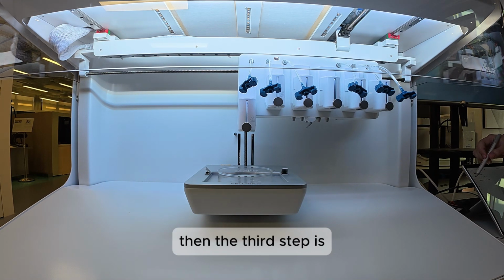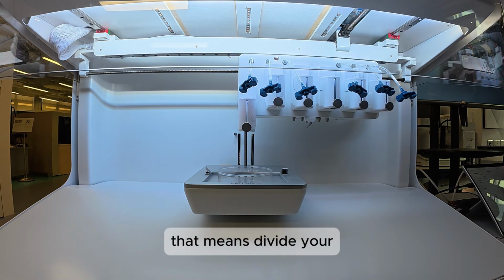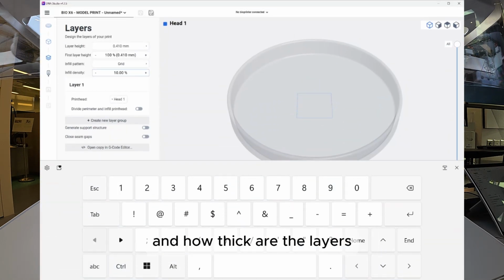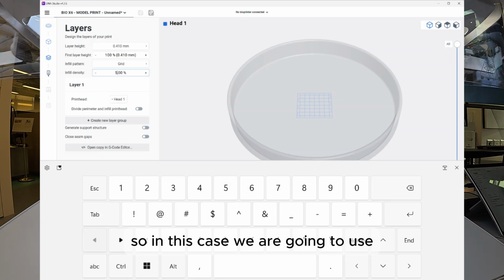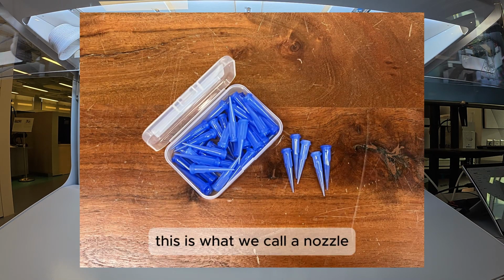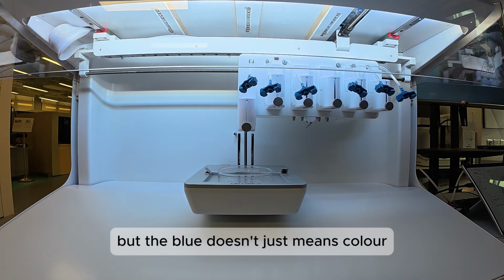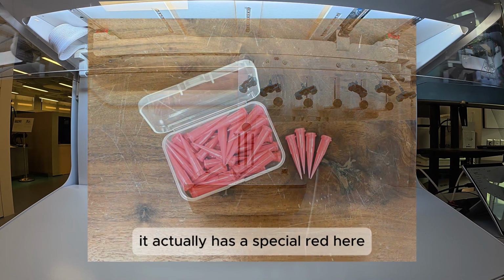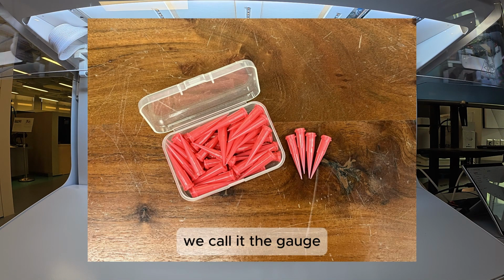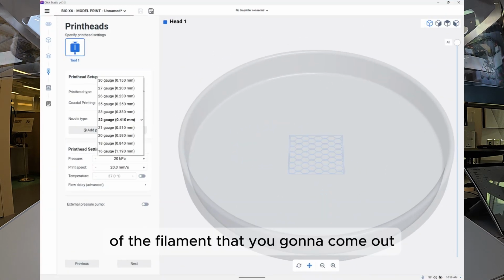The third step is that the printer will do the slicing for you, which means dividing your structure into multiple layers, and how thick the layers are is decided by you. In this case, we are going to use this blue nozzle. We also have a blue needle, but blue doesn't just mean color. It actually denotes a specific grade, the gauge. 22 gauge corresponds to the internal diameter of the filament that will come out.